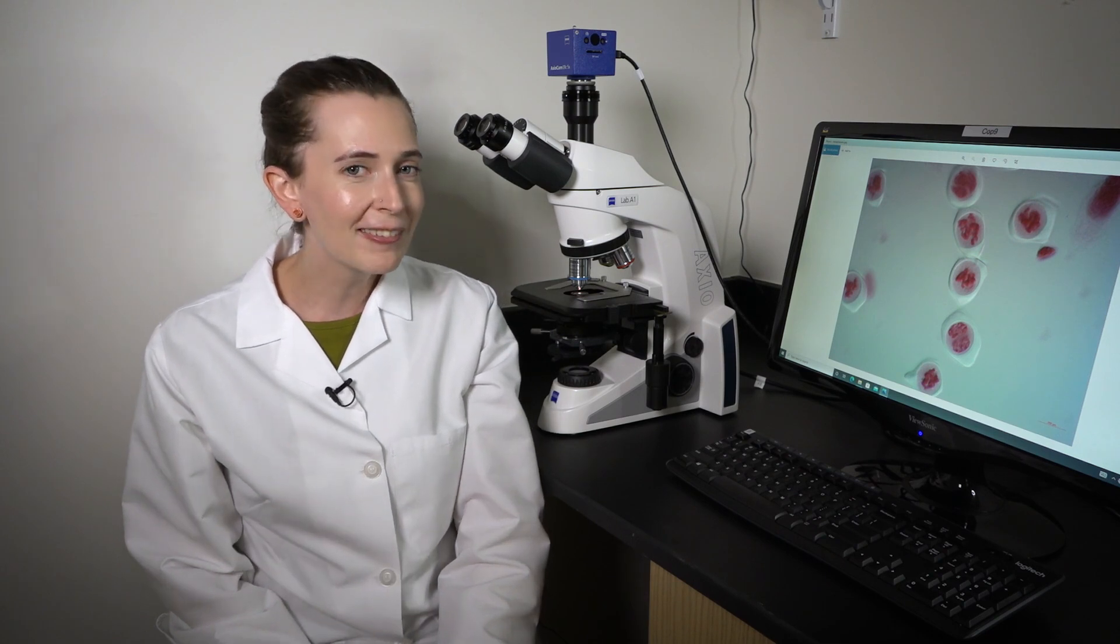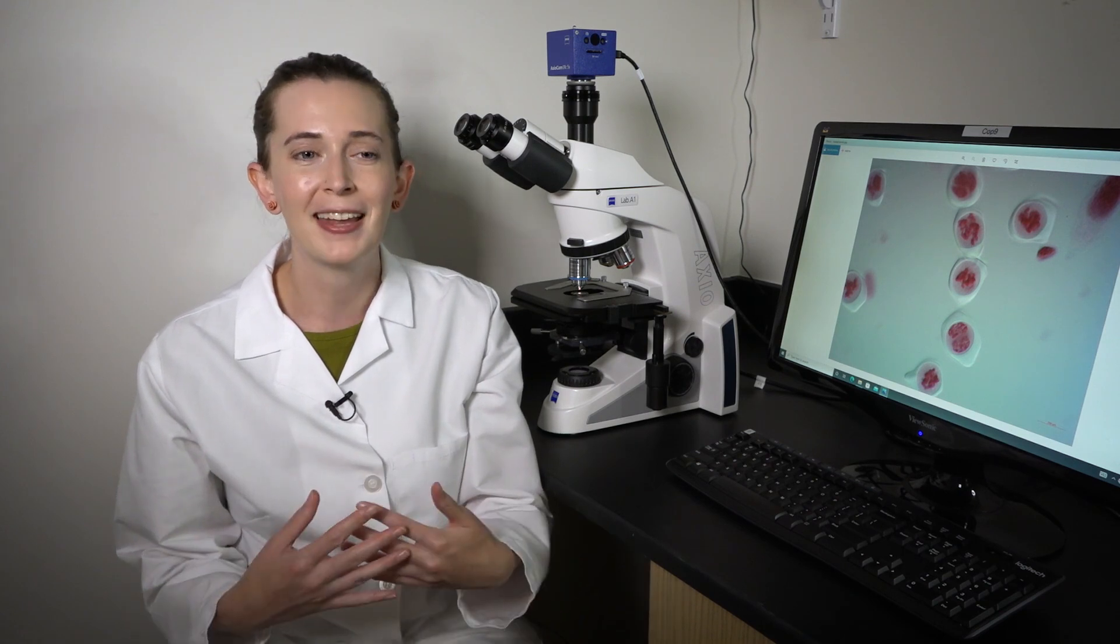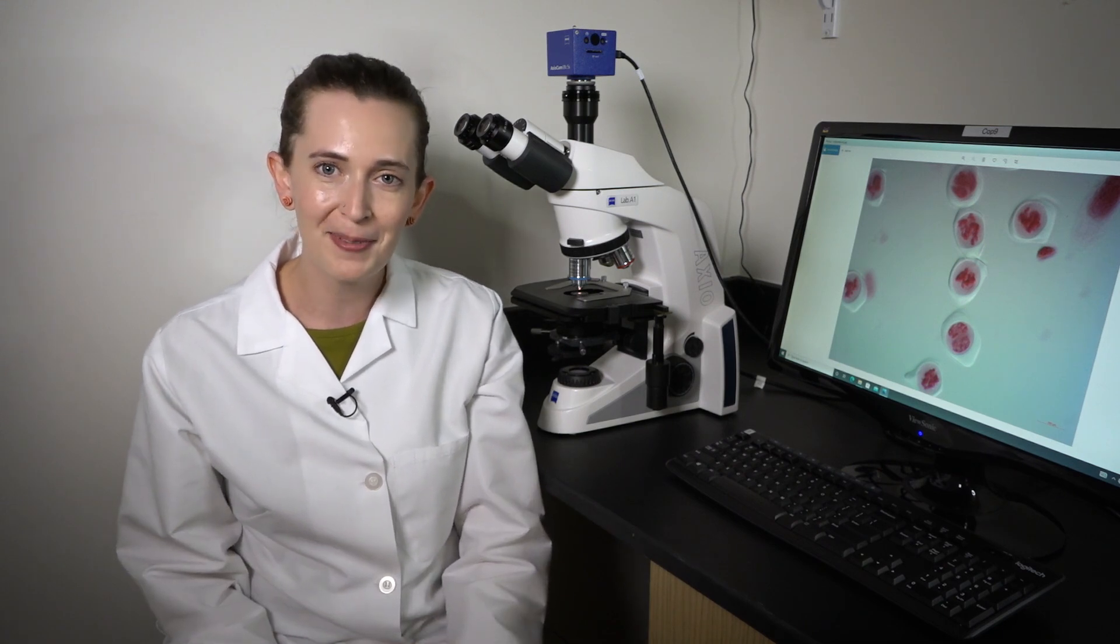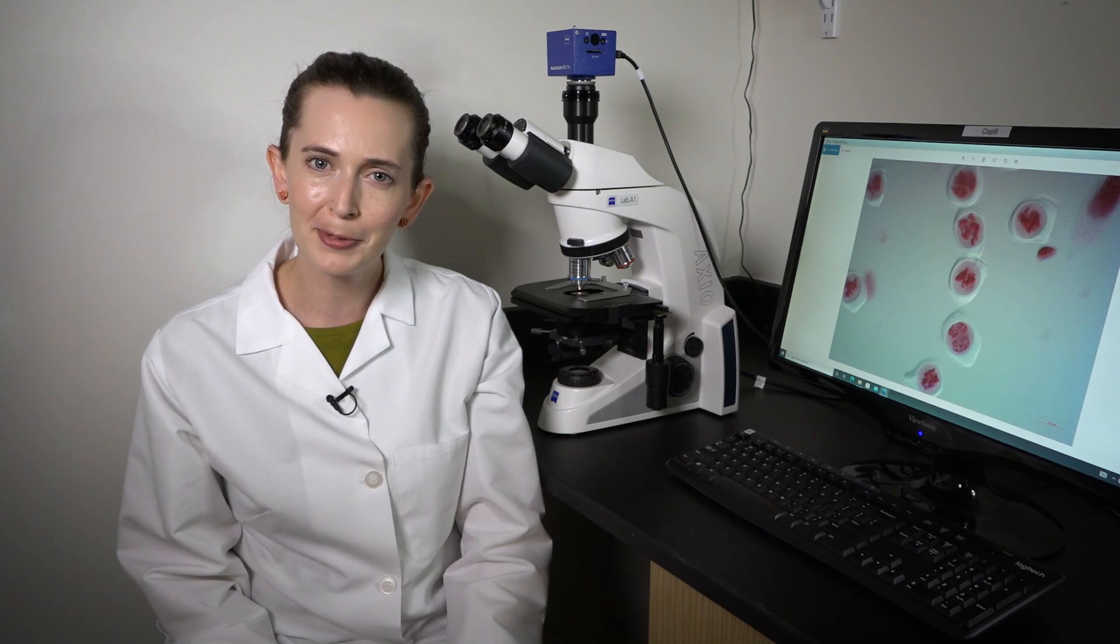I'm not going to show you all of the phases of meiosis today because I want you to explore and apply what you've already learned about meiosis in class to identifying the phases in your own experiment. So go have fun trying to find them all and see what those chromosomes are up to.